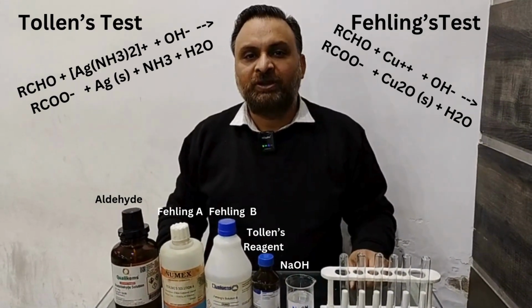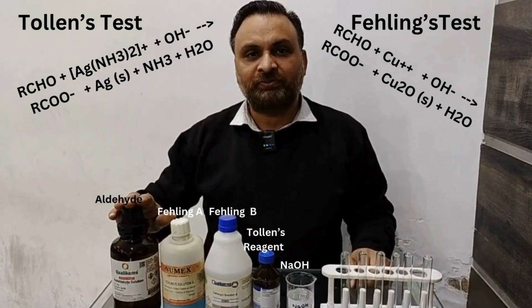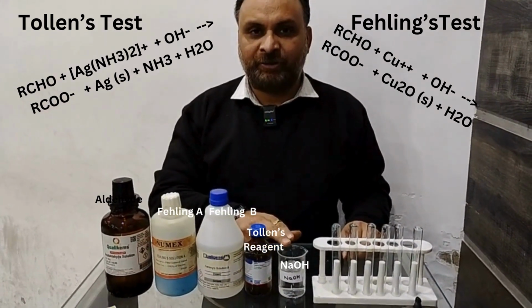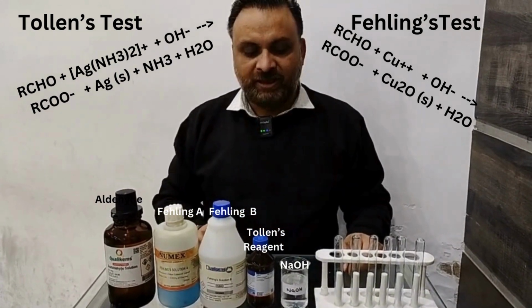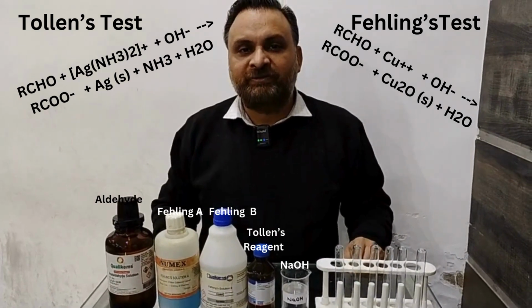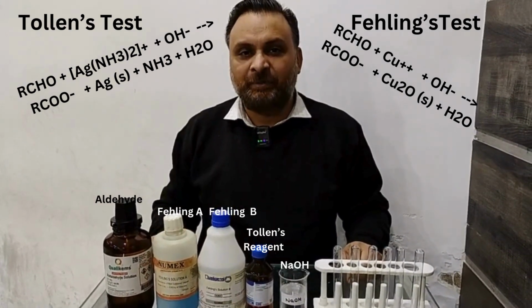First of all, we will perform Tollen's test. To perform Tollen's test, we require this aldehyde solution, Tollen's reagent, and NaOH. It is a very simple test. It is also called a silver mirror test, because when we perform this test, silver is deposited on the inner lining of the test tube and the test tube shines like a mirror.